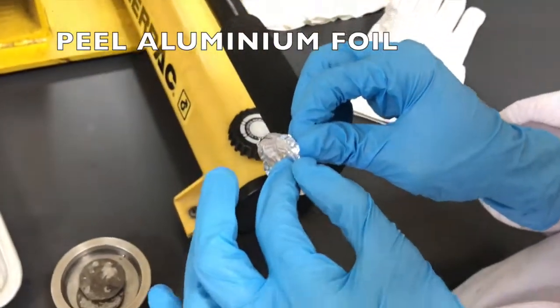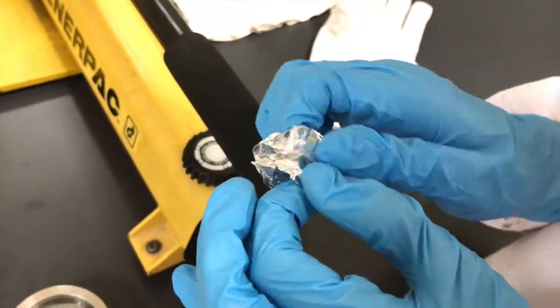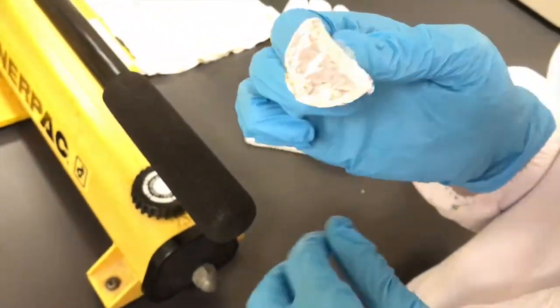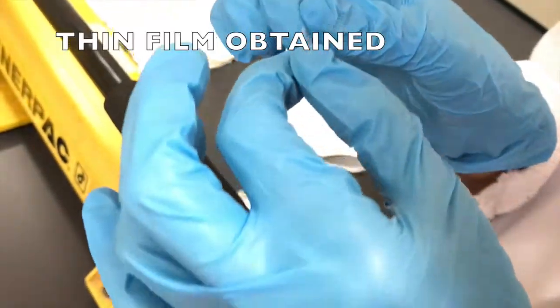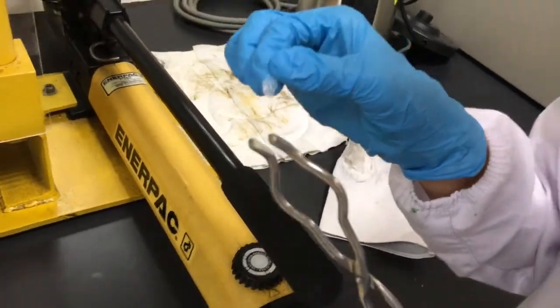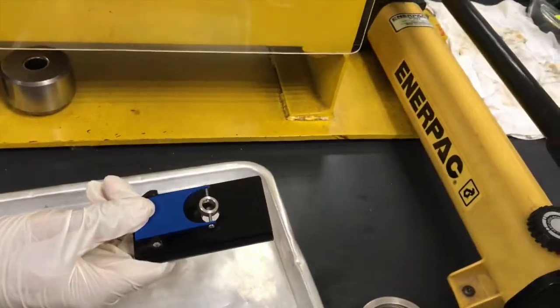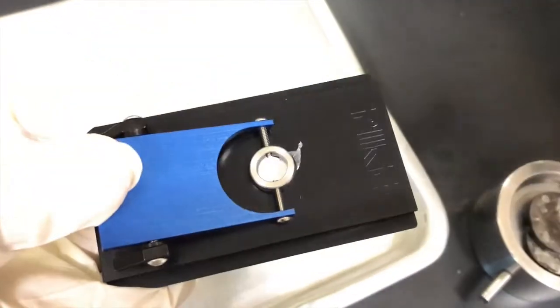Peel off the aluminium foil slowly and carefully to ensure that the film is not cracked and stuck together, as we want to ensure that all the sample film is removed. Afterwards, put the film into the holder, then transfer it to the FTIR machine in transmission mode. Start scanning the machine and the spectra will be obtained. The spectra obtained will help to determine the unknown polymer resin.